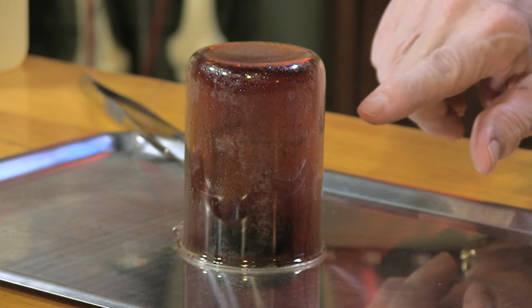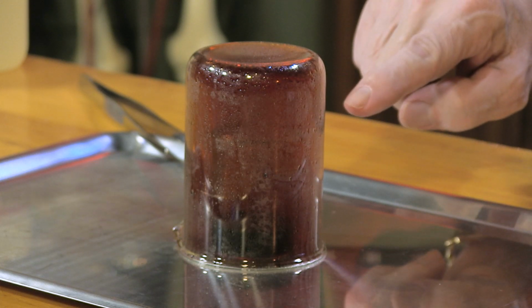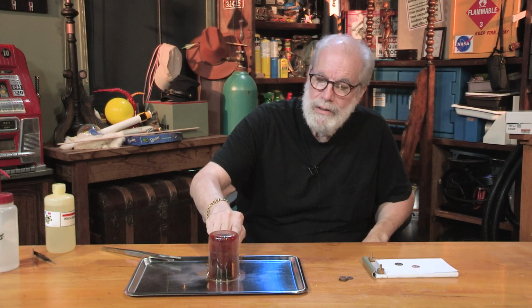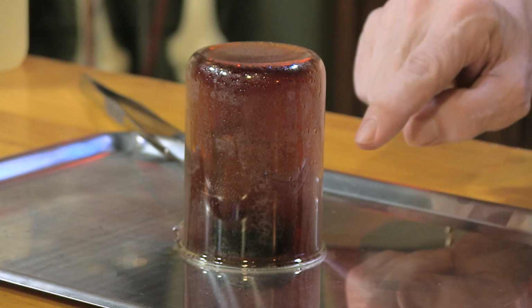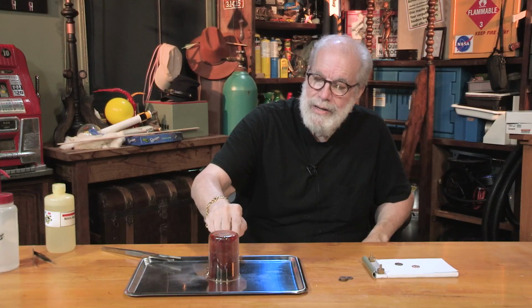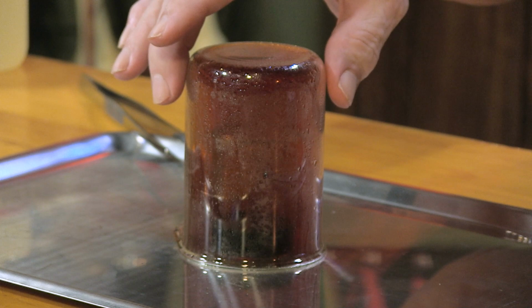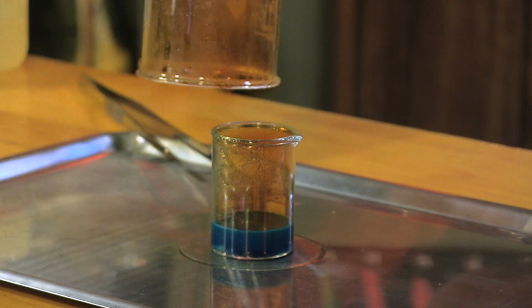Now if you take a close look at the beaker, you can see it's kind of got a mist inside, like condensation. And some of that probably is a little acid spatter, a little nitric acid still. But a lot of that is just water because nitric acid is an aqueous solution. So that reaction got warm enough that some of that water evaporated and then it cooled on the inside of the beaker. Now we've got the studio ventilator on. It's taking all the gas out. There it goes. It's getting sucked up through the filter.